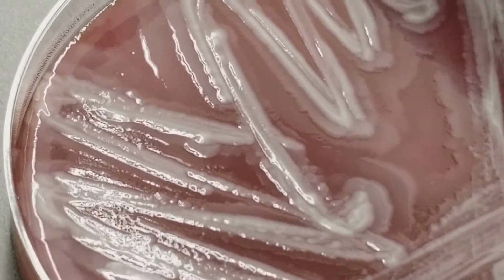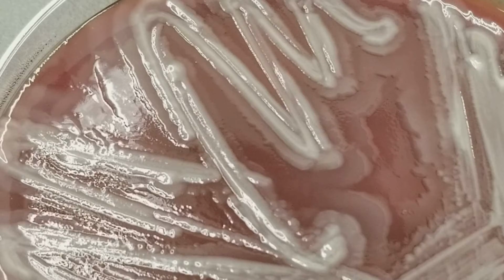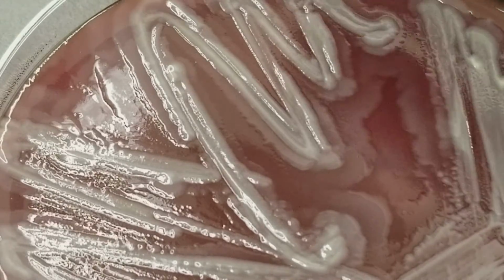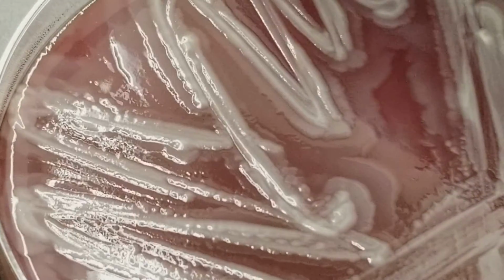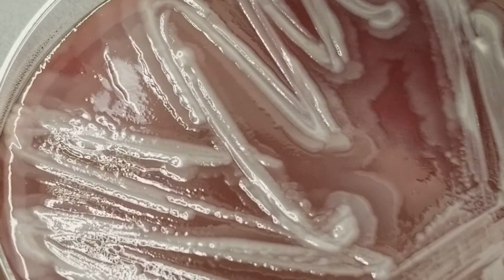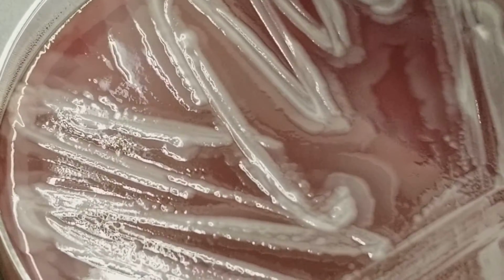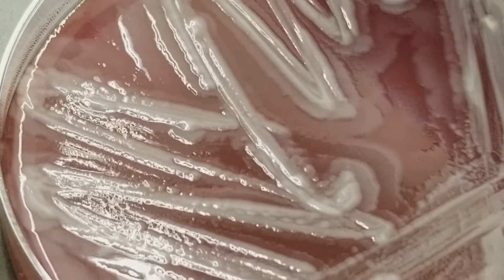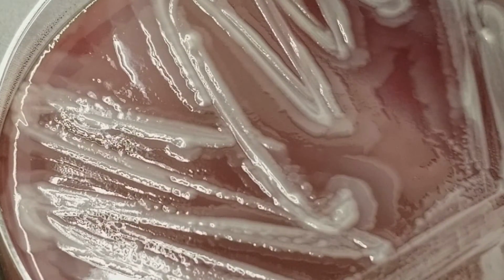All right, this one is going to be fun. This one's from the left arm. Look at that. Isn't that gorgeous? I'm assuming this was from a wound on the arm, and this is a GNR in regard to that scalloping, but also there's what's called swarming, and you can see it because it's waves of growth.